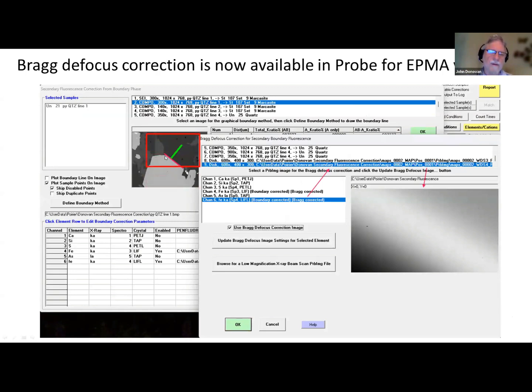So here's an example. Here's a grain boundary measurement where we're measuring iron in quartz adjacent to pyrite. So the beam incident material is quartz and the boundary material is pyrite. What's interesting and important to think about is that as we move away from the boundary, when we do the correction, we consider each point here to be the center of our analysis, because our beam is stationary, but our stage is moving the boundary away. So that boundary is actually moving away from us, and that's when the defocus effect comes into it.